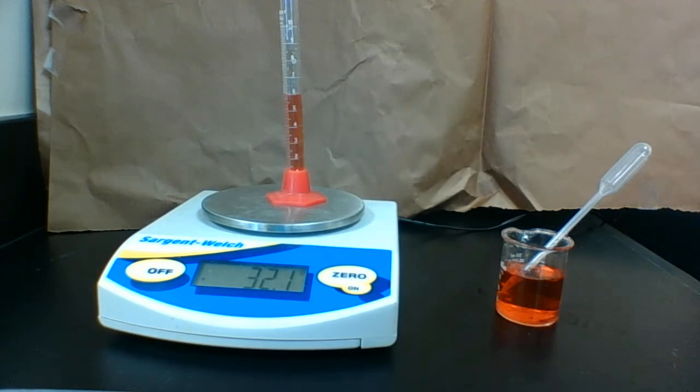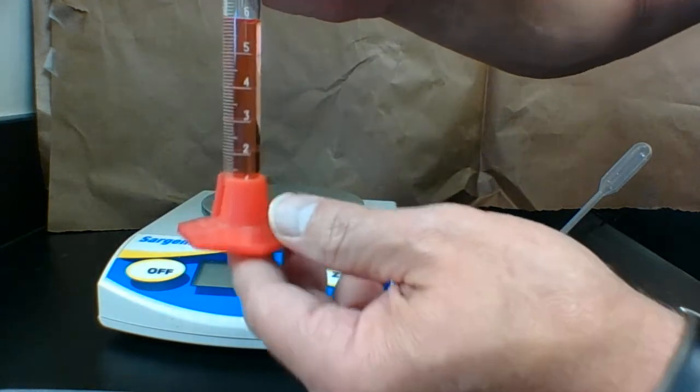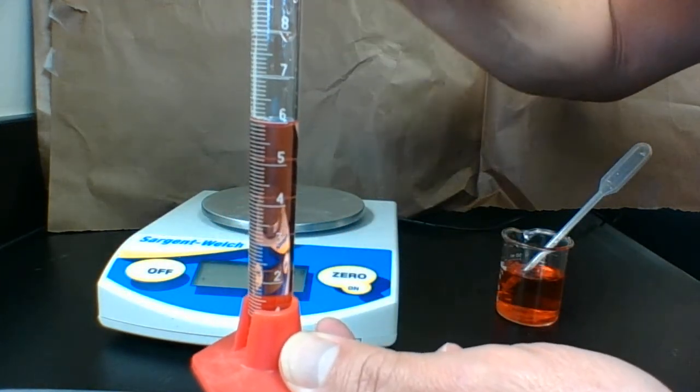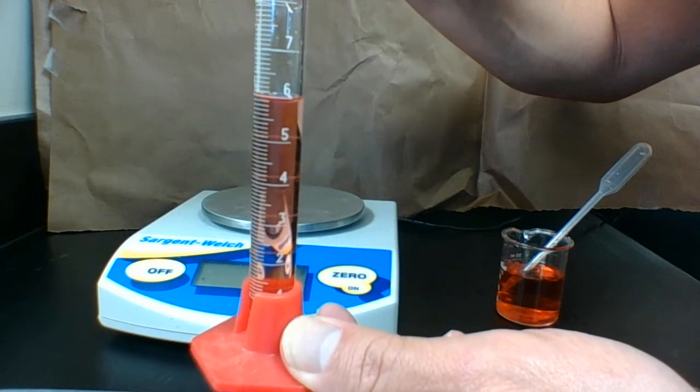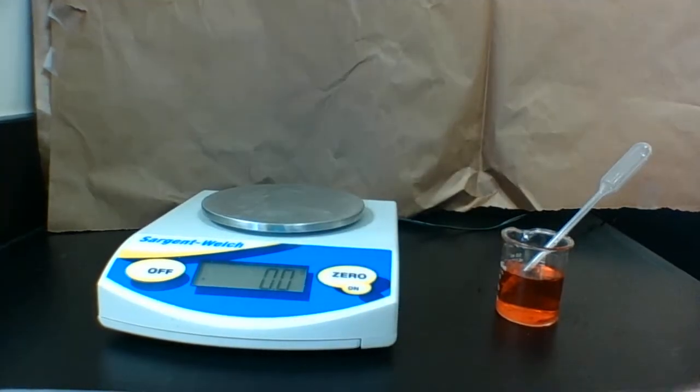There's data that's important to you. And then I'm also going to put this close to the camera so that you can see exactly how much is in that graduated cylinder.